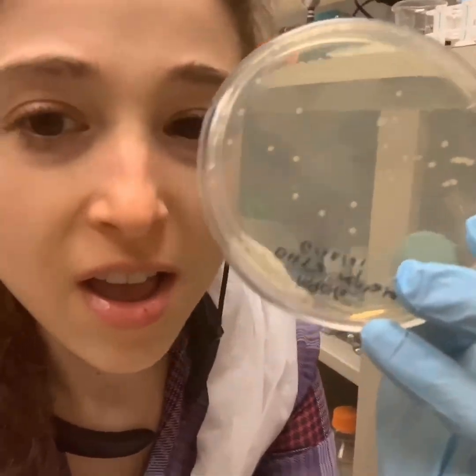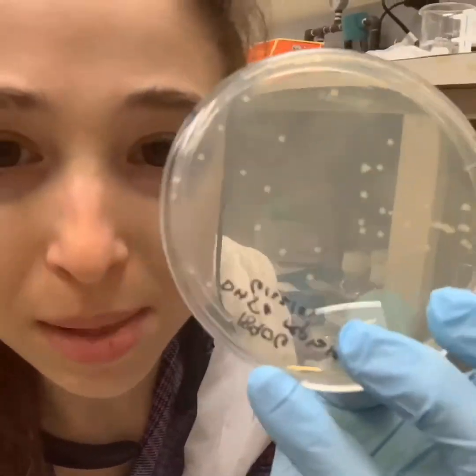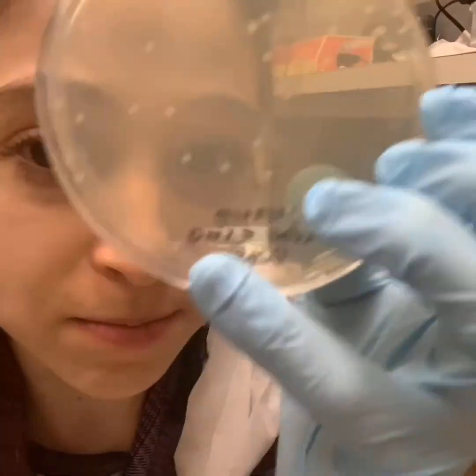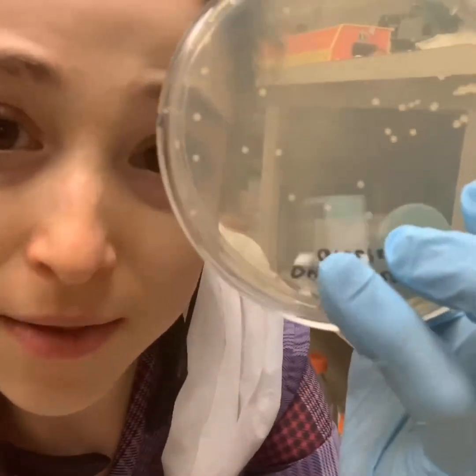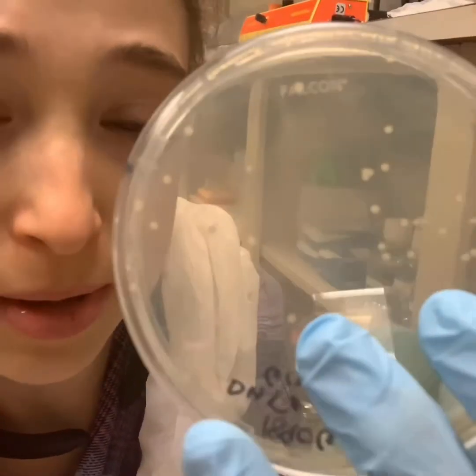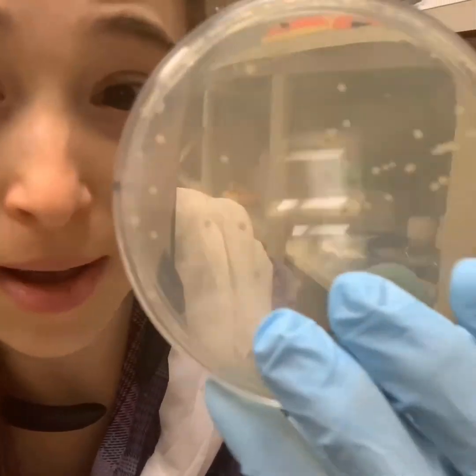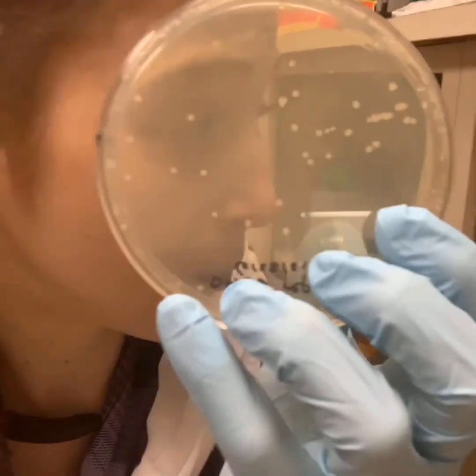These glompy dots on here represent a bacterial colony that has a circular piece of DNA called a plasmid containing the gene for a protein I want expressed. The reason why it's not just a whole big lawn of bacteria — not just covered with bacteria — but you have these actual spots, is because of antibiotic selection. Also on my plasmid is an antibiotic resistance gene to the antibiotic kanamycin, and the bacteria food in this plate is spiked with kanamycin, so only the bacteria that have taken in my plasmid are able to grow and form these dots.